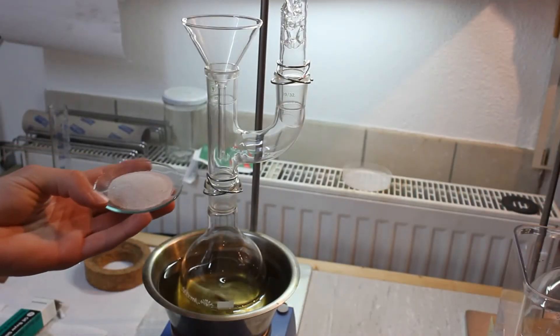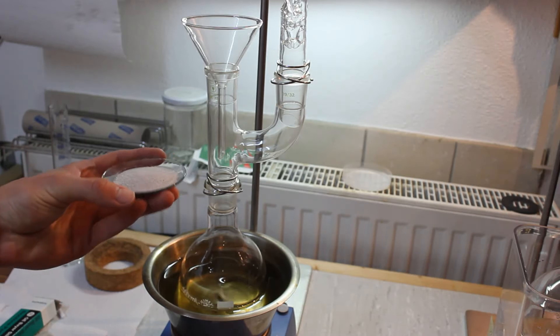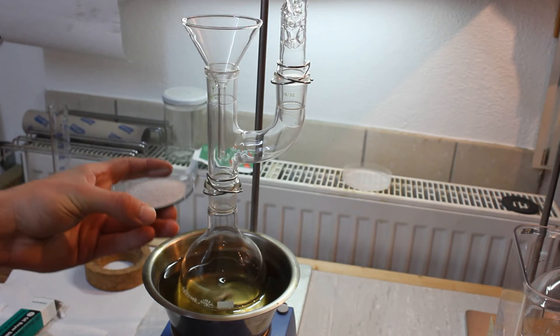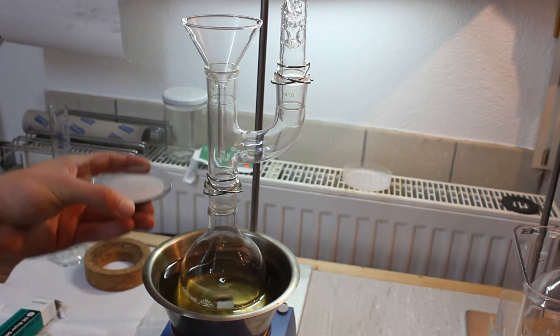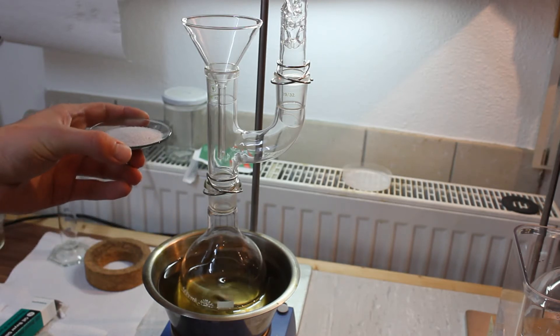Here I have roughly 20 grams of sand that I washed with some hydrochloric acid, then some water and then left it to dry. I'm going to add this so the mixture boils evenly.